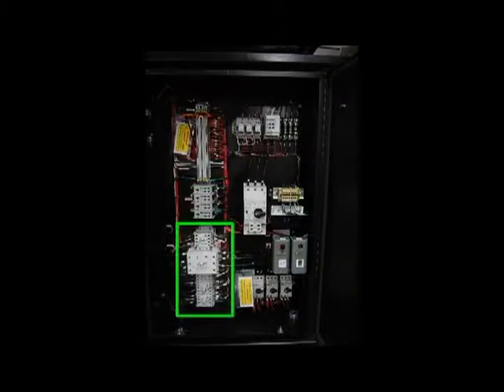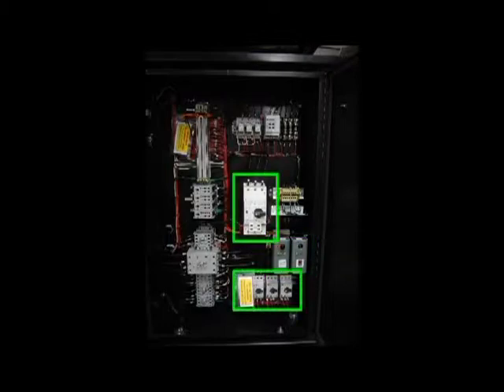The primary components in the electrical box are the terminal strip, which connects and routes all of the signal wires. The contactors. The thermostat, which establishes the set point and unloading temperature for the unit. The breakers. The top breaker is exclusively used for the compressor, while breakers one through four are for the three fans and the pump. The phase monitor that protects the unit from improper phasing. The LED on the phase monitor should be green. If the LED is red, then two of the legs will need to be reversed. Finally, the refrigerant fuse. This is a small glass fuse used for the compressor. The cage is orange, so it can easily be identified.